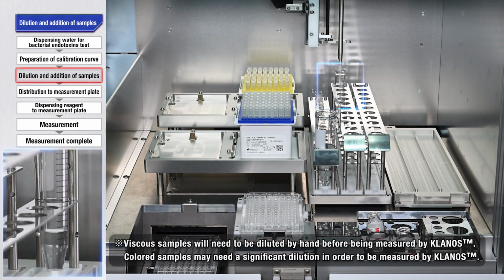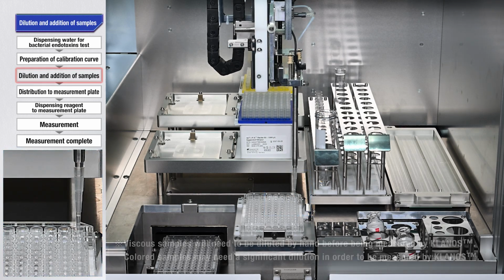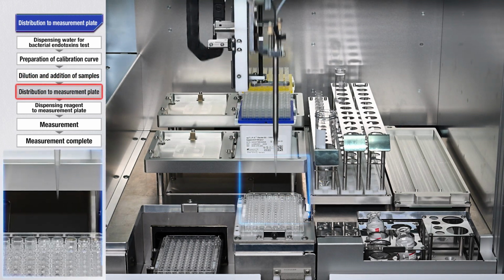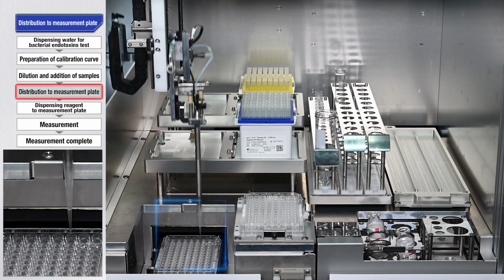The test sample is prepared on a microplate. The prepared sample is dispensed into the measurement plate.